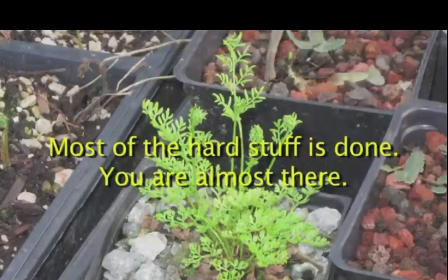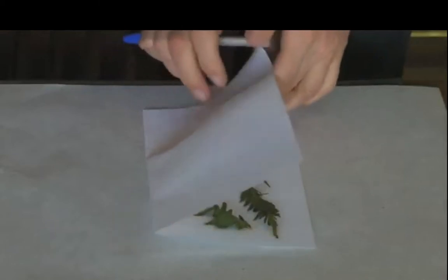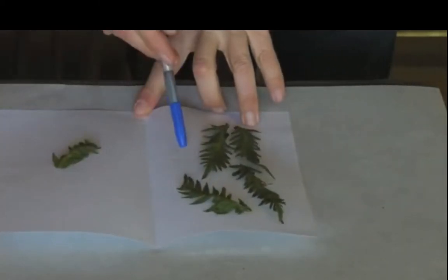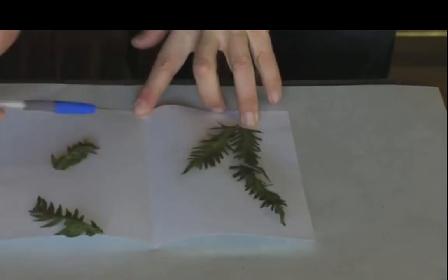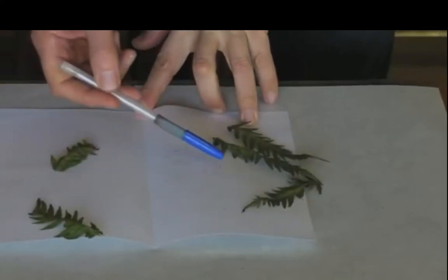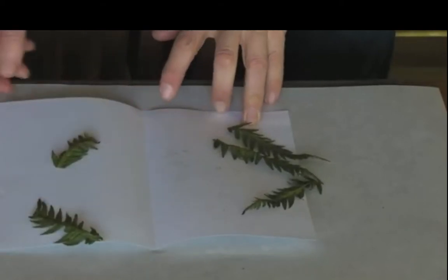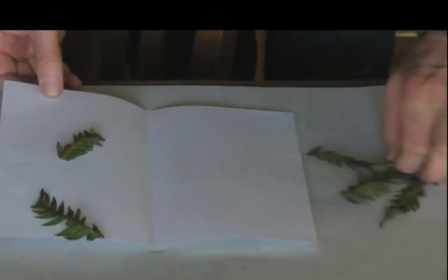Okay, your Petri dish is ready and cooled, and the frond has been dropping spores for a couple of days, so you're almost ready to sow the spores. Open up the paper with the frond and check that the spores have dropped. You'll see anything from yellow to black dust. Usually there's more than you see here, but this particular frond was collected after most of the spore had dropped.